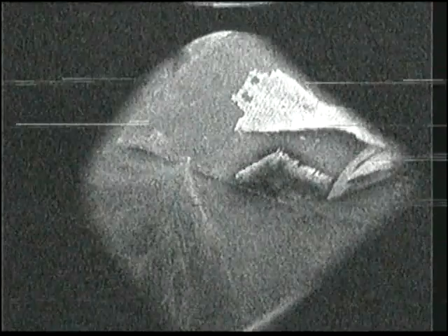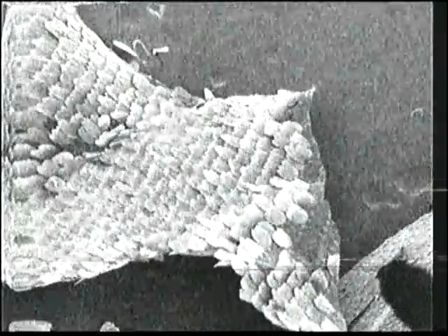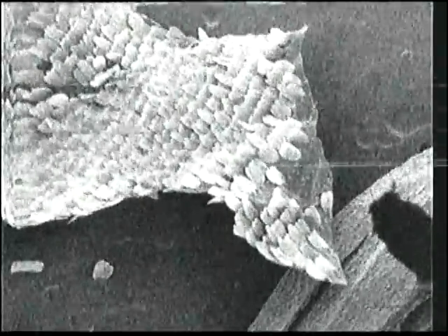Let's continue our tour. We now move to a butterfly wing that did have color in it in the light. You should be interested to know that butterfly wings do not actually have pigments that I know of. They get their color from the nanostructures in the way they refract light.